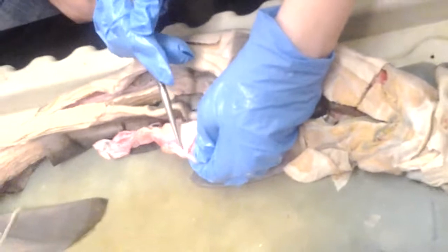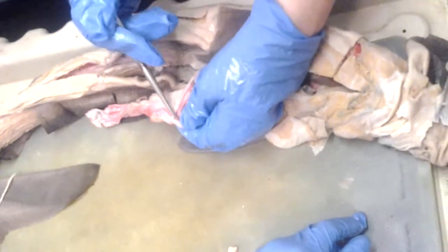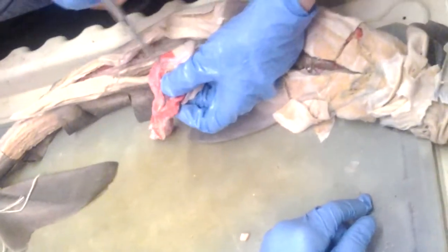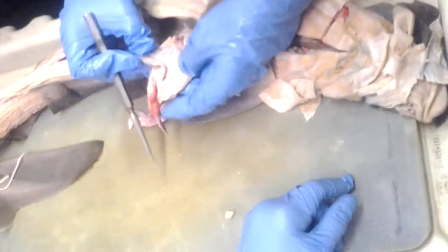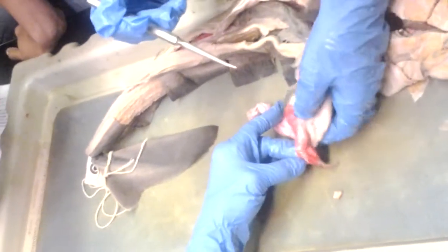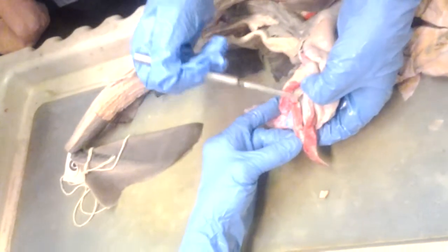The duodenum is the part of the intestine right behind the pancreas. It's right after the stomach and right after the pyloric sphincter. So this would be the duodenum. Now, the ventral lobe of the pancreas, and do we see the isthmus? I don't know if you can see it. You'd have to break the mesentery, so you would just know that it connects. This is all dorsal lobe of the pancreas.